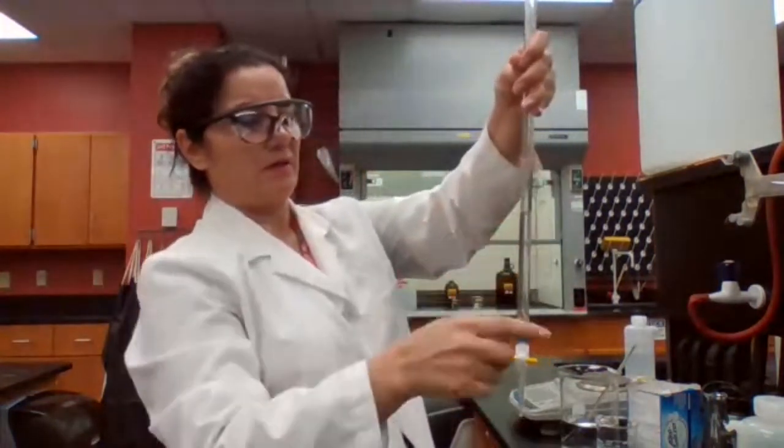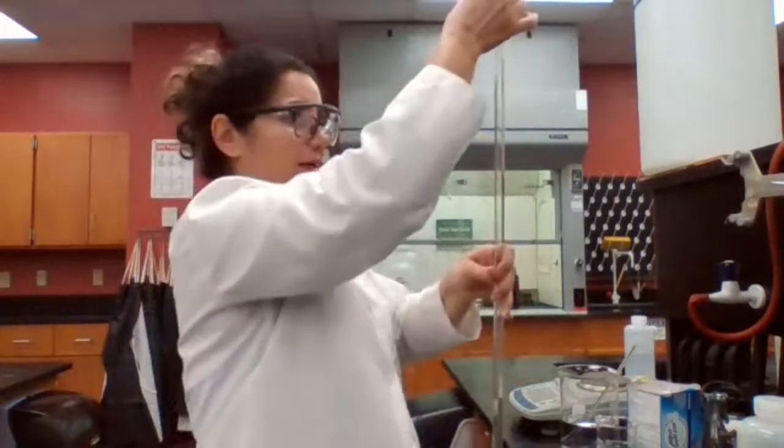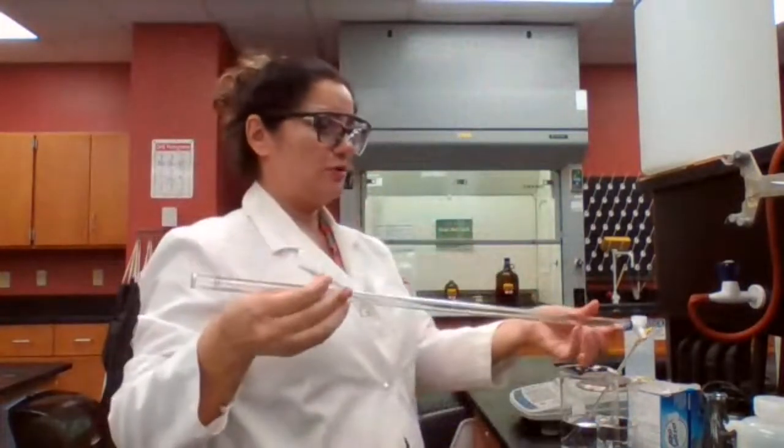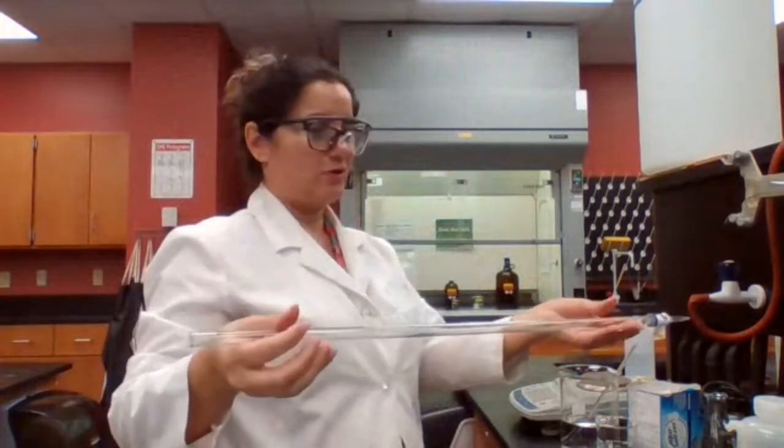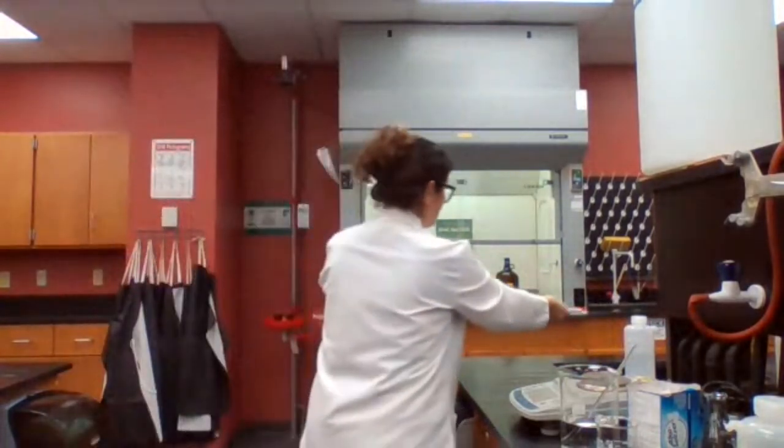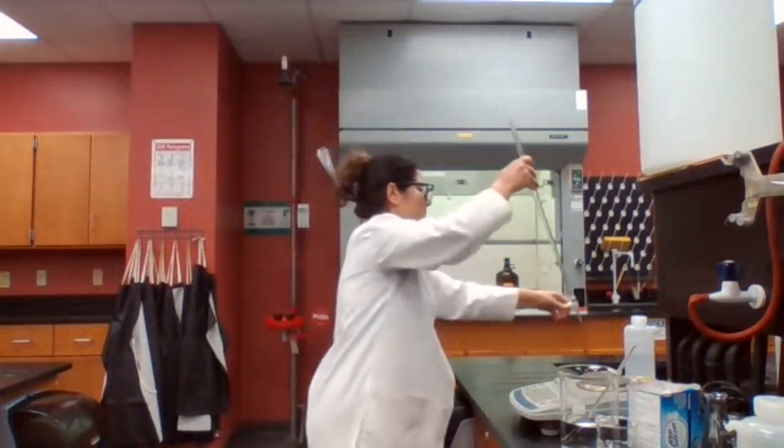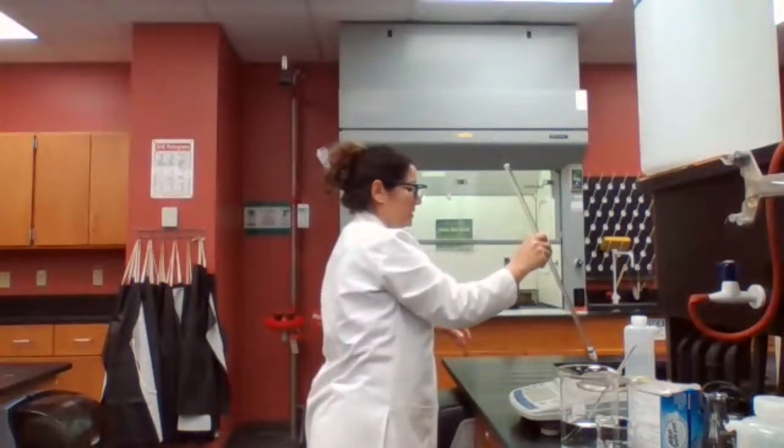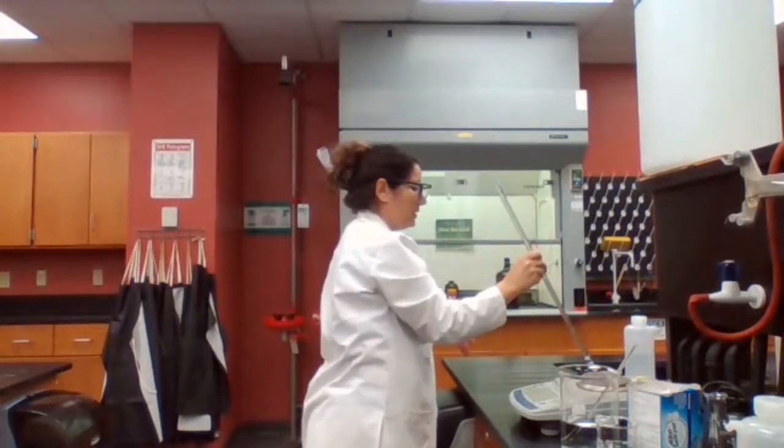Now take the funnel out. Similar procedure: I'm going to rotate it to make sure the inside of the burette is completely rinsed with the sodium hydroxide. I don't need that solution, so I'm going to discard it.